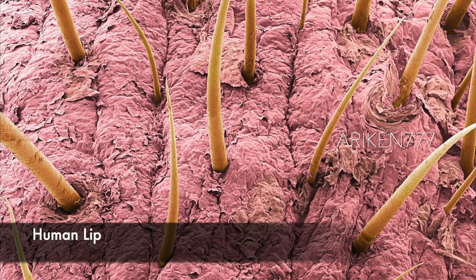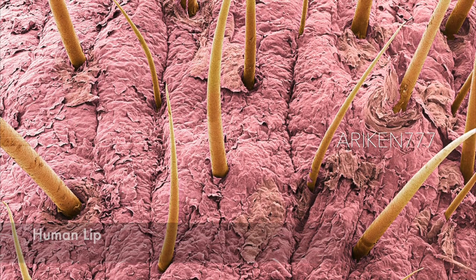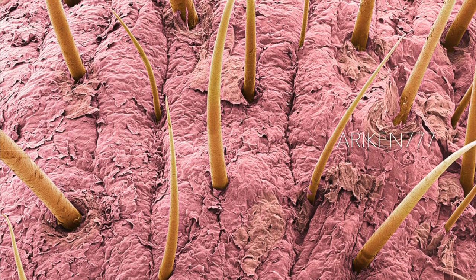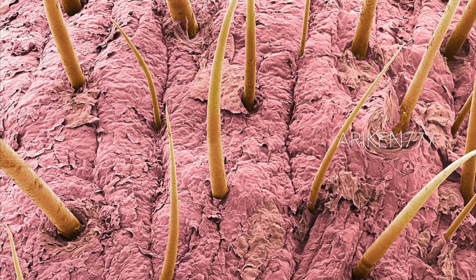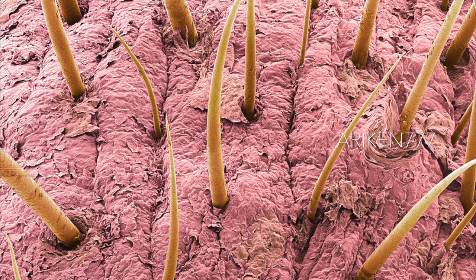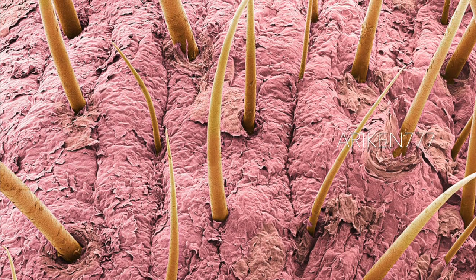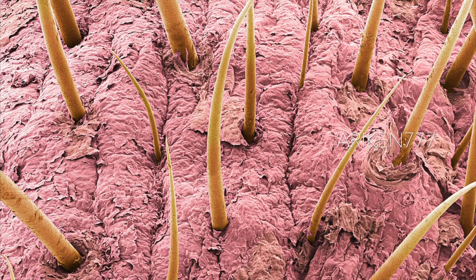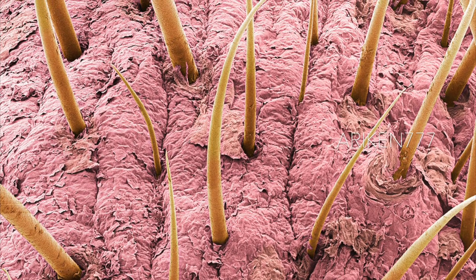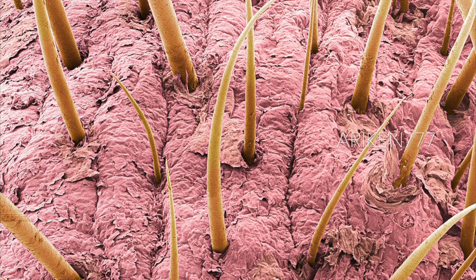What you're looking at here are hairs on the upper lip of a person. The skin of your lips is incredibly thin, as it has only 3 to 5 cellular layers compared to face skin which typically has up to 16 layers. Because of so few layers and the blood vessels which are so close to the surface, your lips appear pink or red.